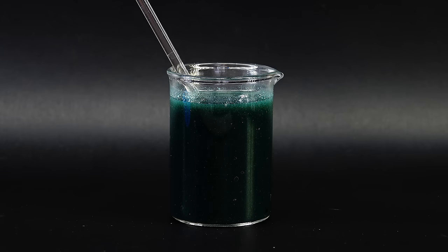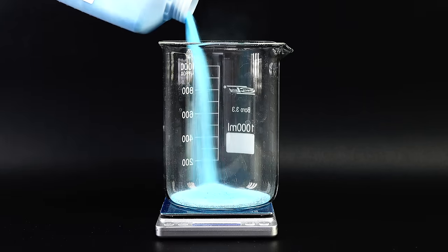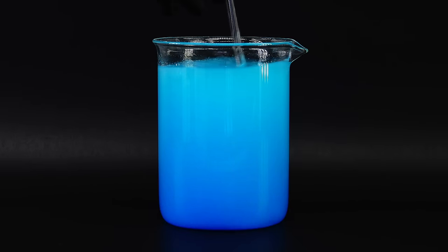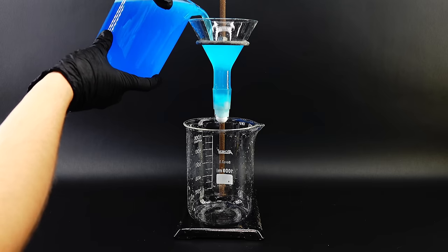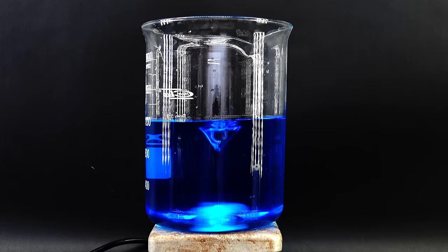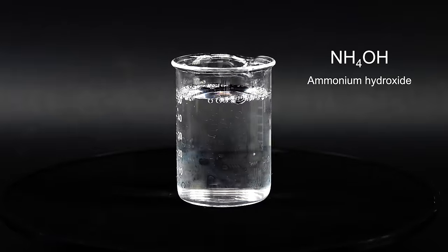There is a more complicated way to make some copper hydroxide that nicely avoids all those problems, and it's the one I decided to go with. I weighed out 100 grams of copper sulfate pentahydrate, then dissolved it all in a liter of distilled water. If it were pure, the solution should be transparent, but in my case it was weirdly opaque with this slimy crust on top. To get rid of this forbidden jello, I passed this solution through a cotton filter and it fortunately came out nice and clean. To turn it into copper hydroxide, I got it all into a monstrous beaker and put it on my hot plate with magnetic stirring. I now have to add some ammonium hydroxide, which is a water solution of this really stinky gas called ammonia.